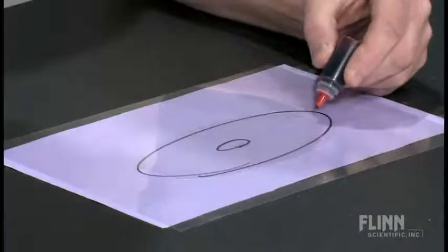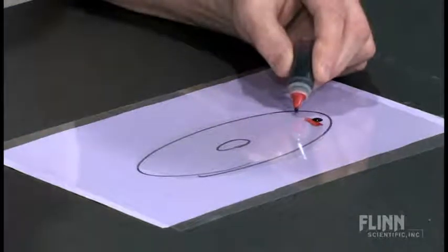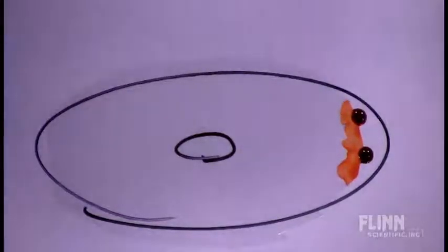Well, a drop of liquid hits that contact lens, lands near the edge, or two drops of liquid, and you'll notice what starts taking place. The liquid that splashes in your eye is wicked underneath the contact lens and is pulled actually over the eye. You go to the eye wash station and rinse it off. It does a really terrific job of knocking the material off the surface. Yeah, that's pretty gross looking. But the material that went up underneath the contact lens is still there.